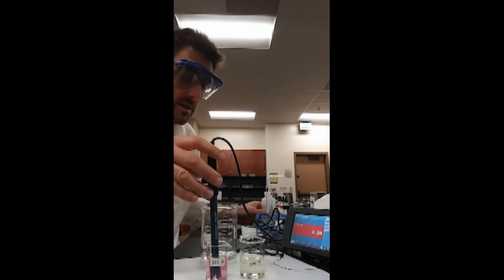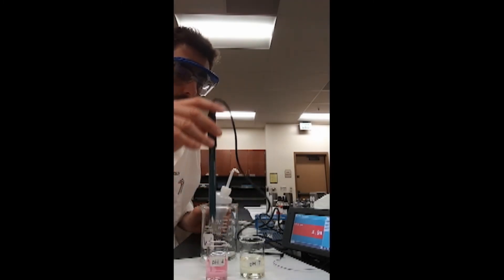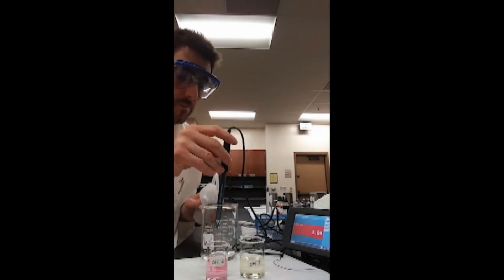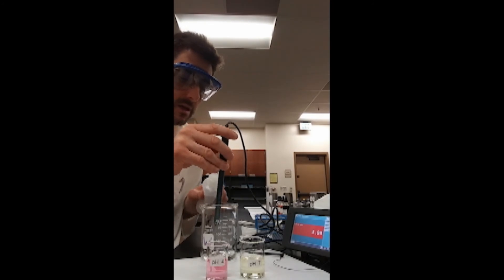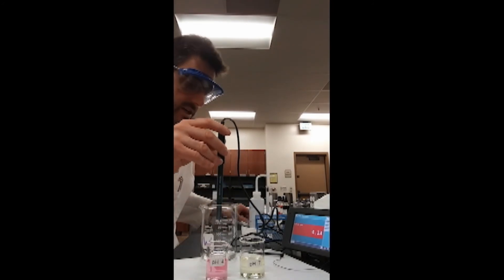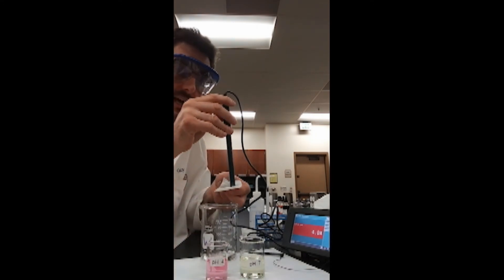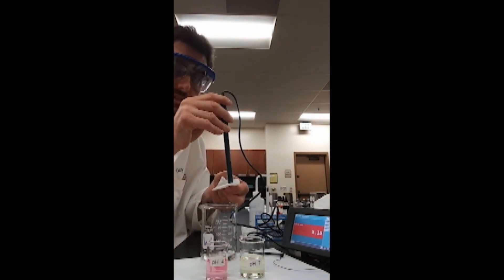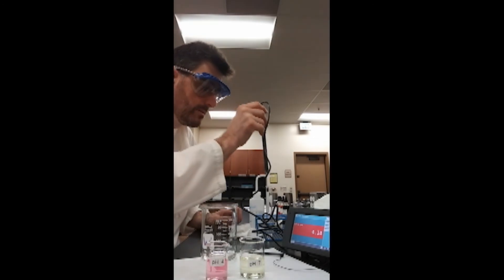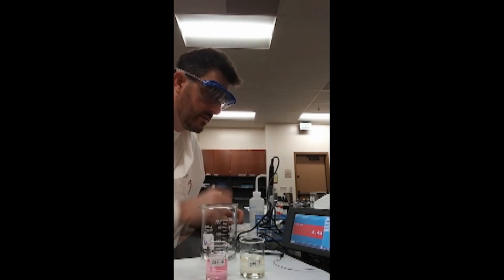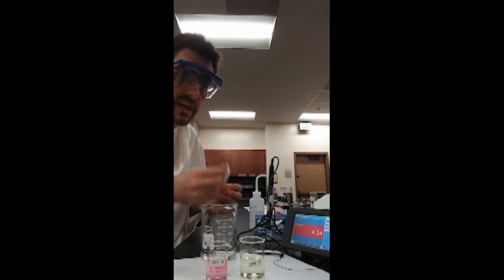However, this process of washing off the probe and blotting the electrode is to be performed every time the electrode is removed from a solution and before it's immersed into a new solution. You'll be going through a lot of chem wipes.